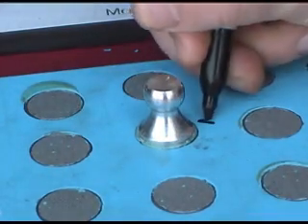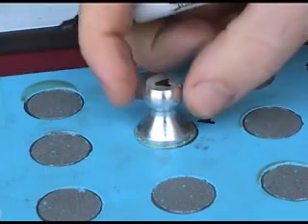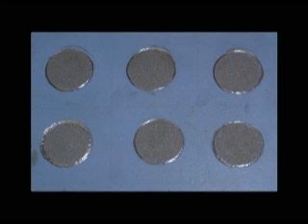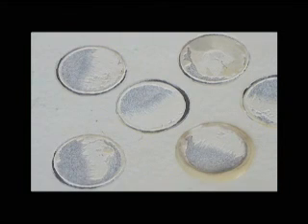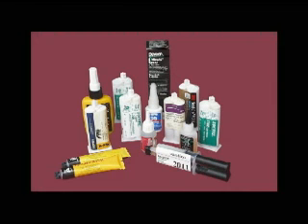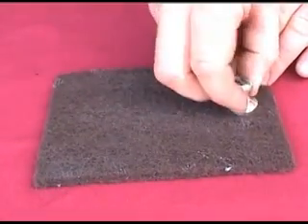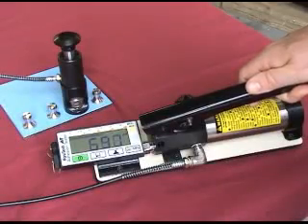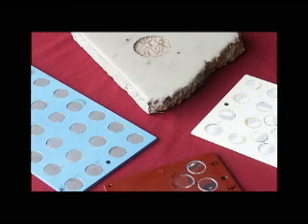Mark the dolly for future qualitative analysis. An ideal pull-off test removes 100% of the coating from the substrate or particular coating layer. Anything less may require both quantitative and qualitative analysis. To conclude, the pull-off adhesion testing process is made up of several critical steps: the selection of an appropriate adhesive, preparation of the dollies and coatings, adhering the dolly to the coating, the dolly pull-off process, and the final analysis of test results.